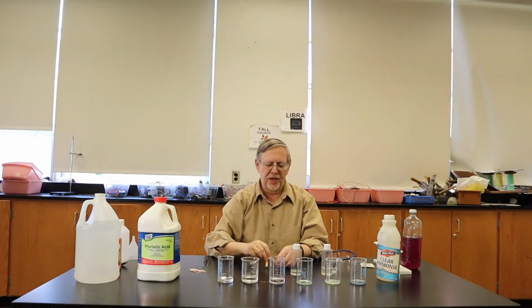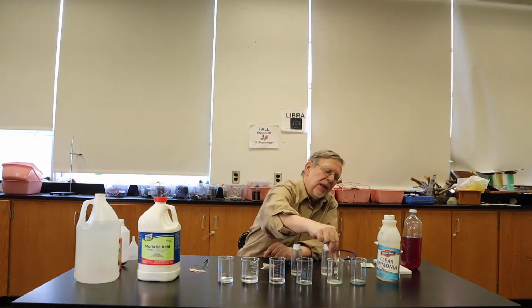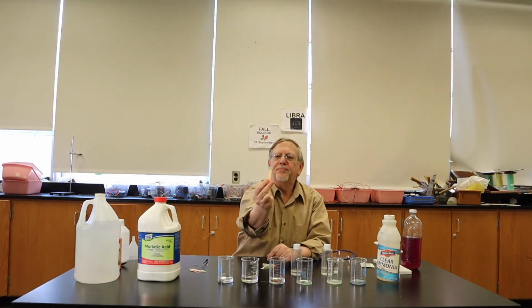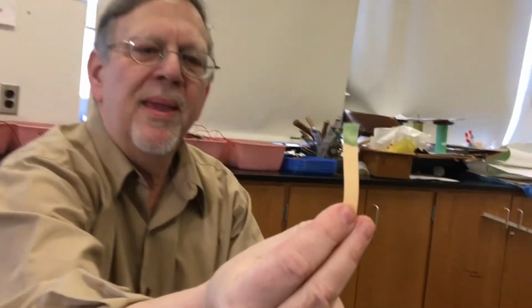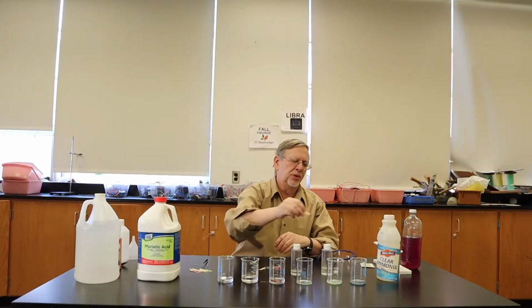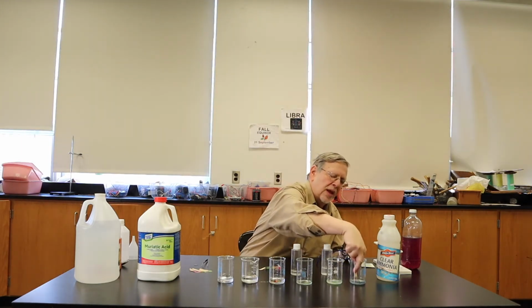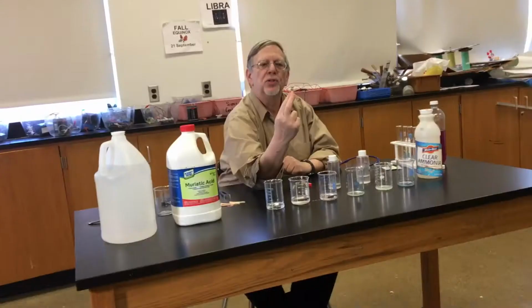This is followed by a stronger base, calcium hydroxide, otherwise known as lime water, and this one gives us a slightly darker green. And last but not least, we have ammonia, which is a much stronger base, and here it should be close to a greenish blue, or this is even a darkish blue color, stronger than I anticipated.